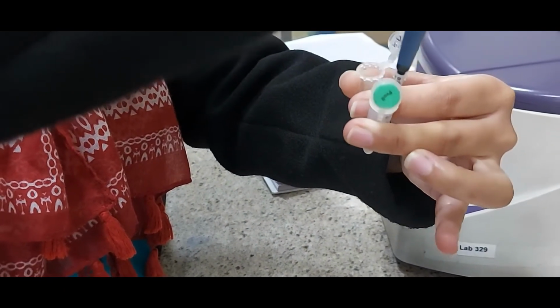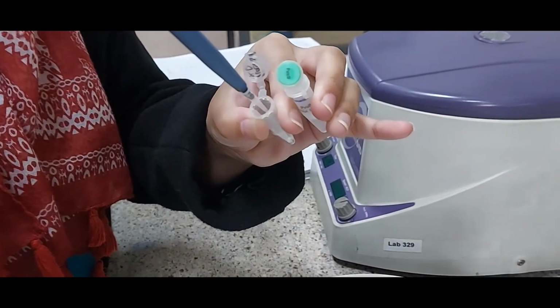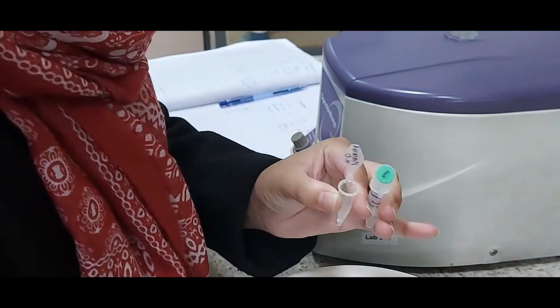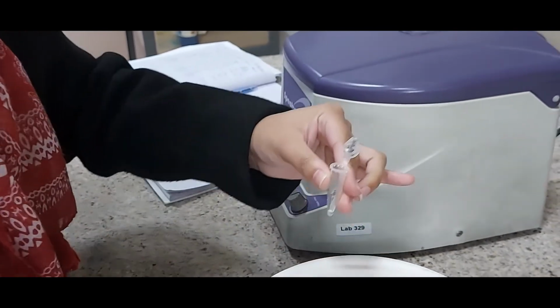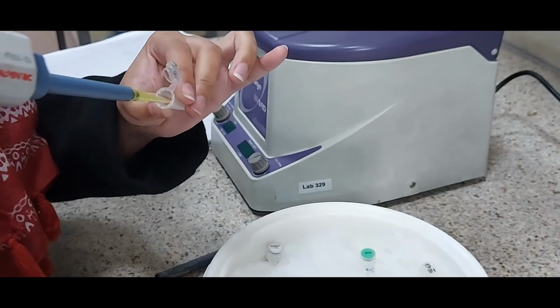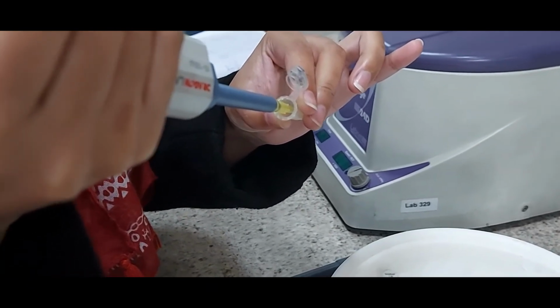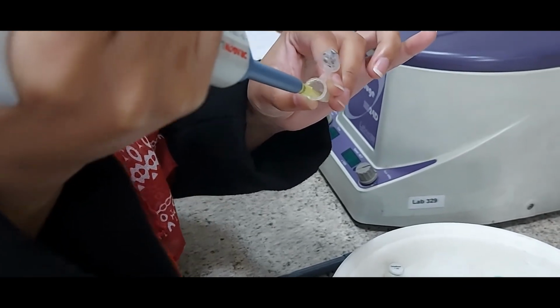That's PvuII, 1 microliter, and this is being added. So all the 4 ingredients are complete now in the plasmid tube. So that tube is ready for incubation at 37 degrees centigrade. But by the time she puts it in there, she will set up the second reaction so that we can transfer both of the tubes together to a 37 degrees centigrade water bath or a hot plate.